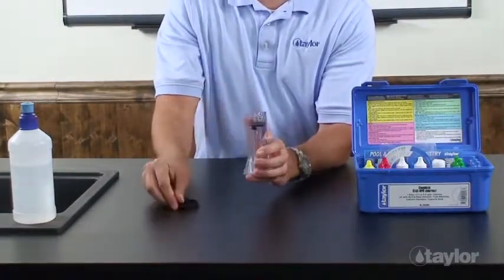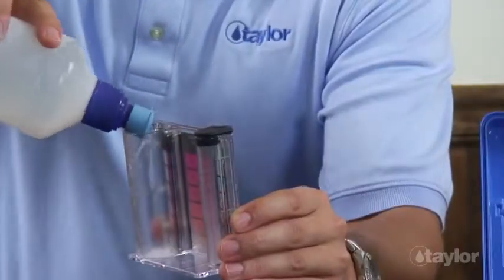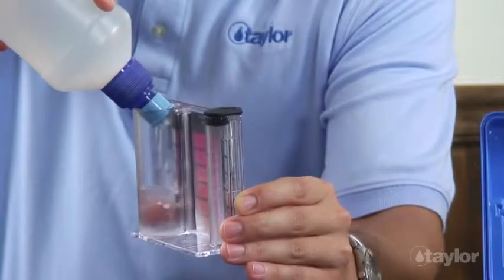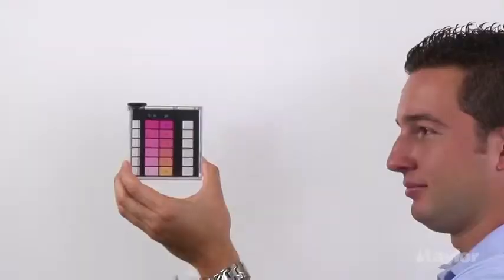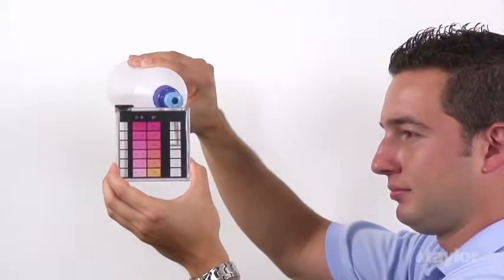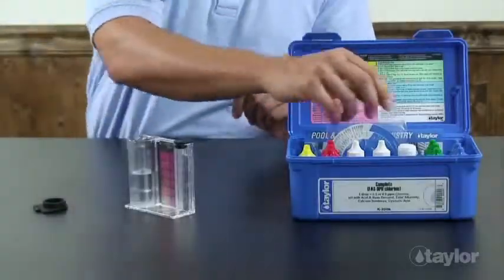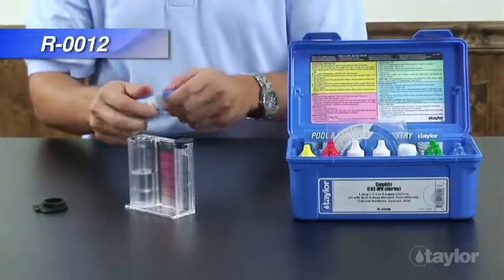Rinse and fill the large comparator tube to the 25 ml mark with the water to be tested. Add 5 or 6 drops of reagent 12 to the sample before adding the buffer and indicator.